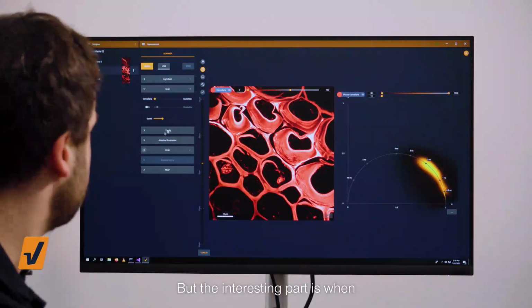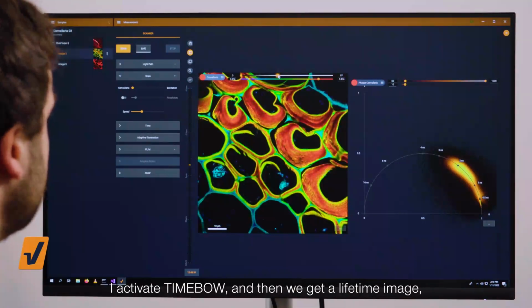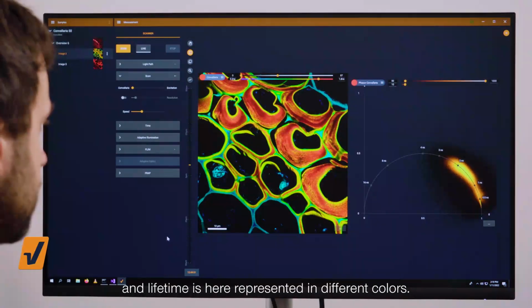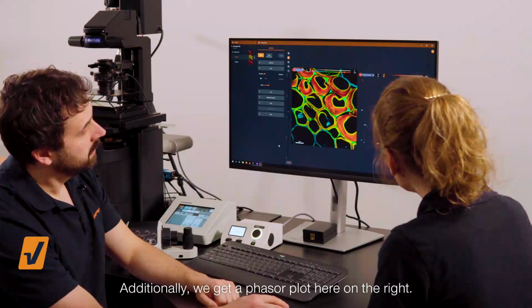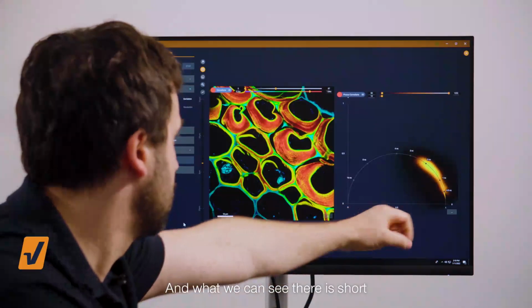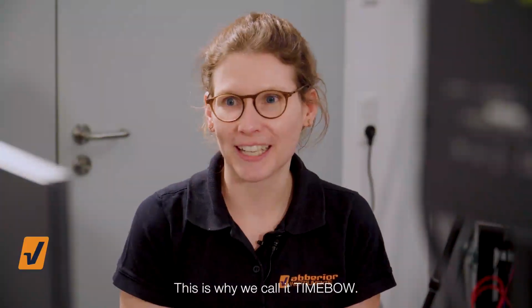But the interesting part is when I activate TIMEBOW, and then we get a lifetime image. And lifetime is here represented in different colors. Additionally, we get a phasor plot here on the right. And what we can see there is short lifetimes going along this bow or arc shape to longer lifetimes. This is why we call it TIMEBOW.